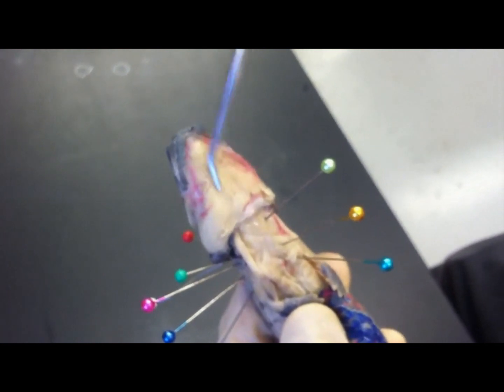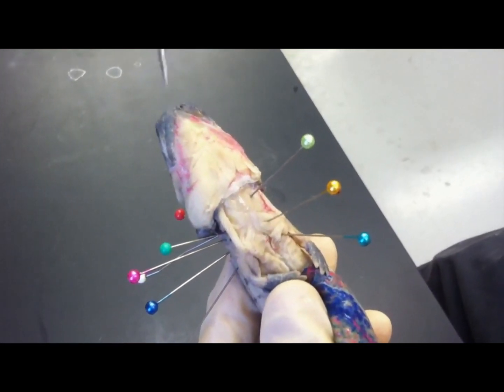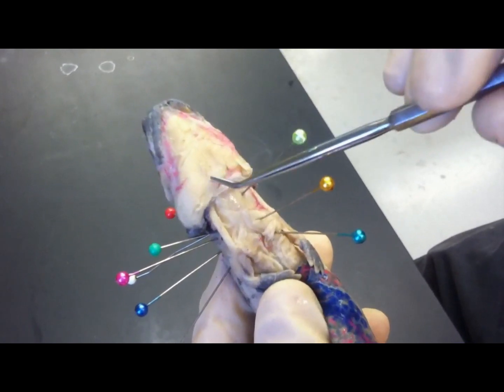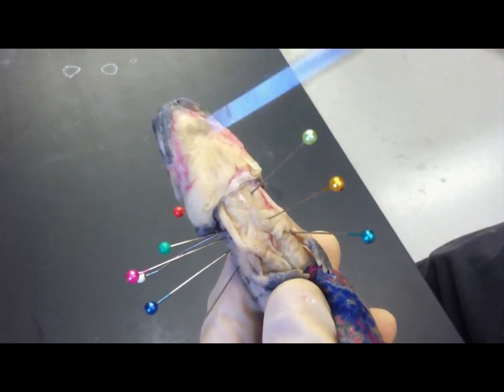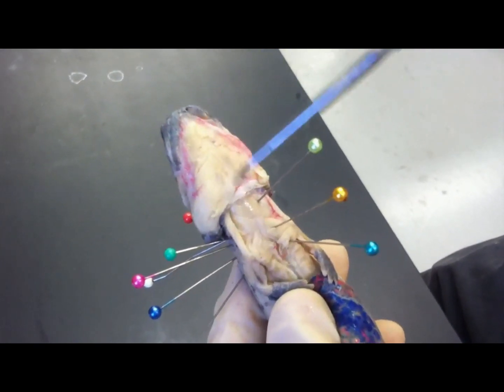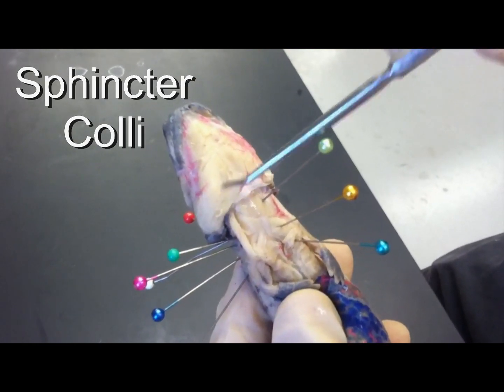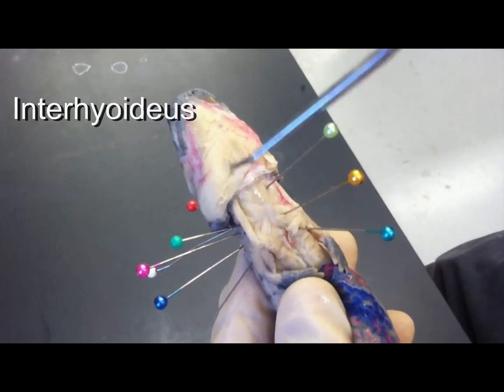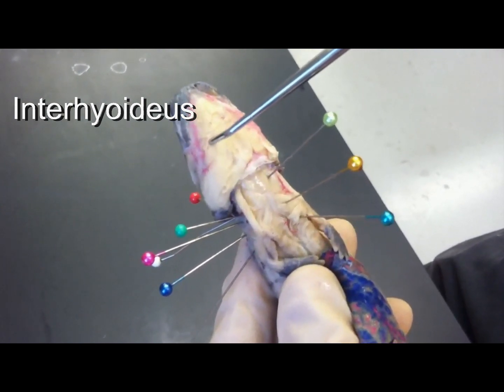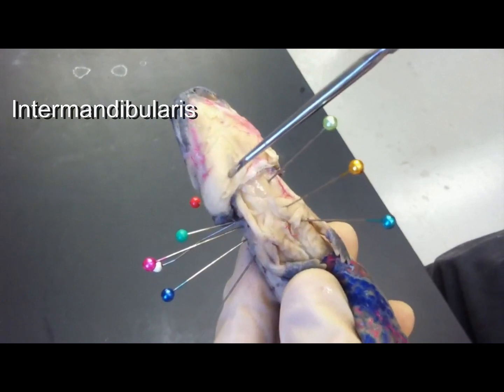Covering the lower jaw, the lower mandible, you have the sphincter colli. There are three muscles here — you can't really differentiate between the three, but sphincter colli is the most caudal, and then you have interhyoideus and intermandibularis.